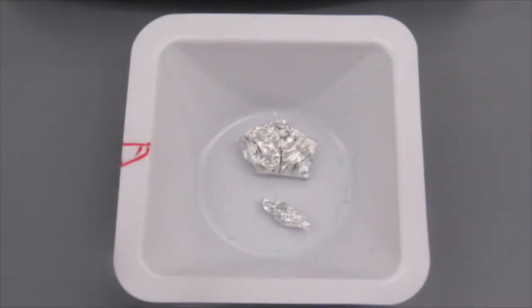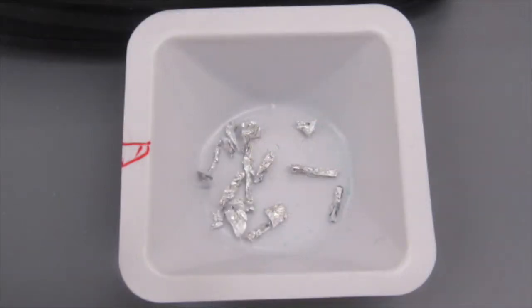We use just a simple aluminum foil. I like to cut it up into smaller pieces, and I find that it works much better, and it reacts much more quickly and readily if you do that.